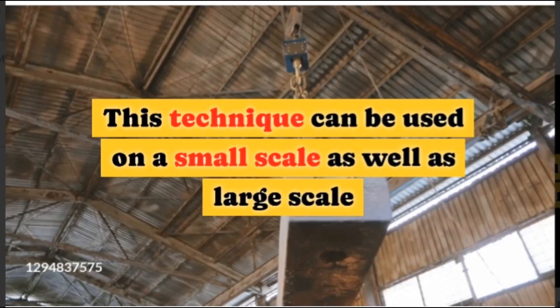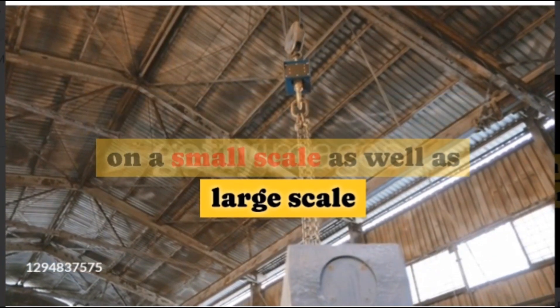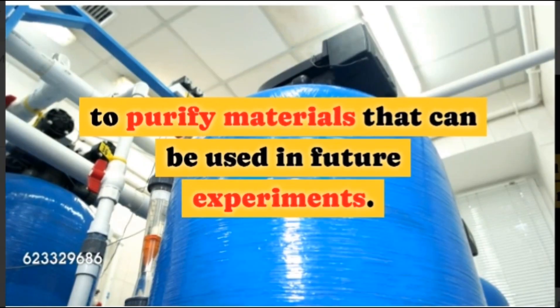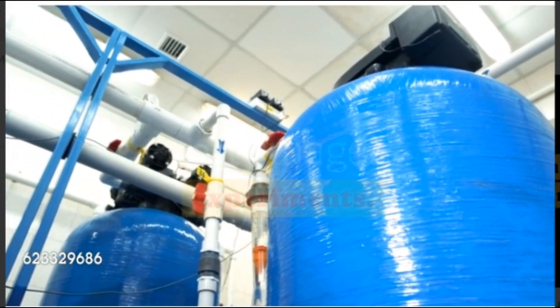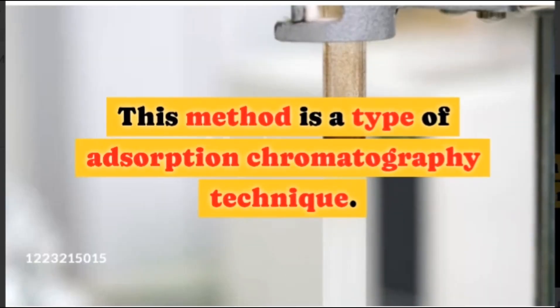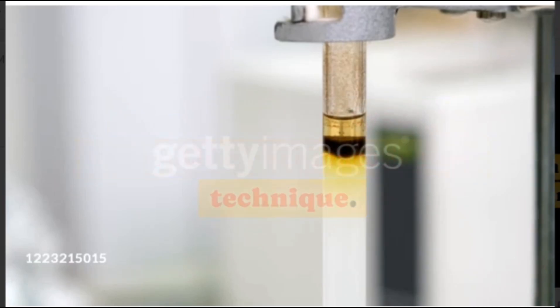This technique can be used on a small scale as well as large scale to purify materials that can be used in future experiments. This method is a type of adsorption chromatography technique.